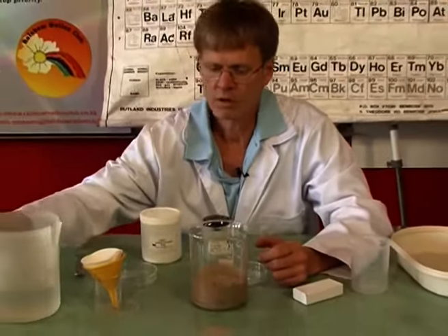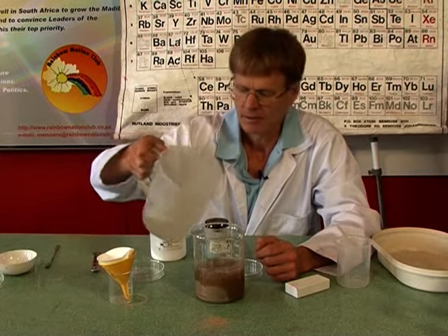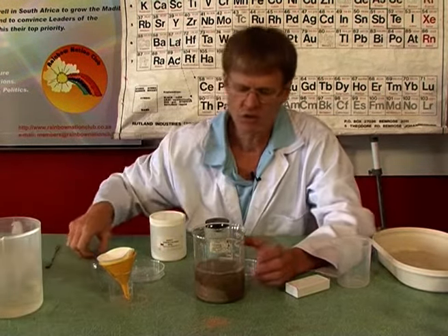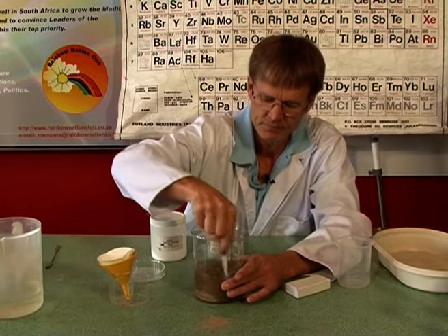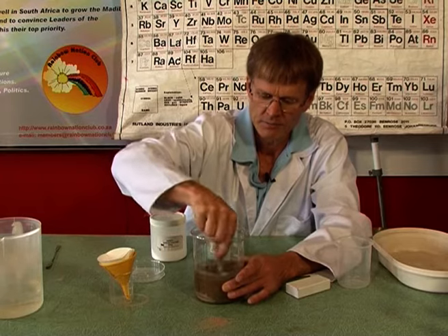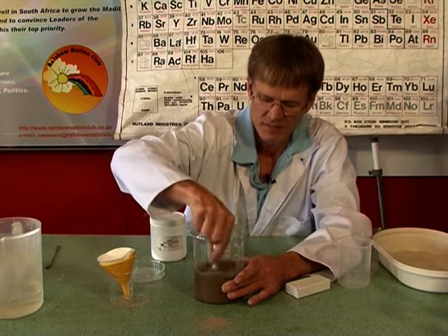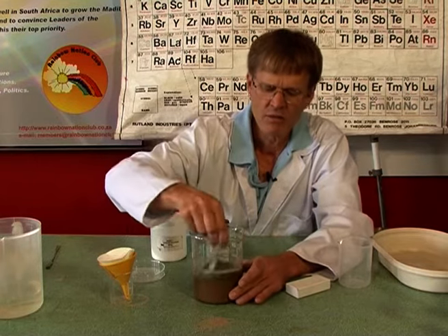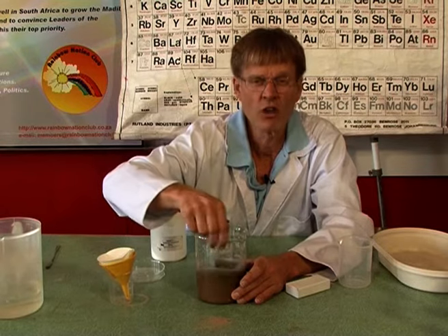Well, I'm going to take some water. And I'm going to stir it up. And I'm going to stir it for some time until I make sure that all of the salt has dissolved.